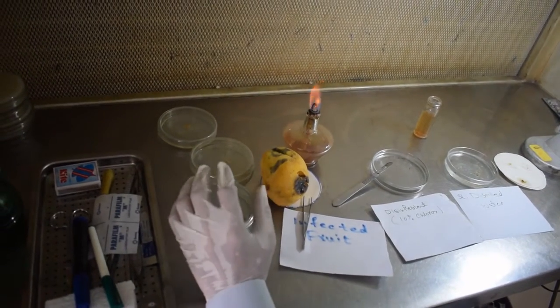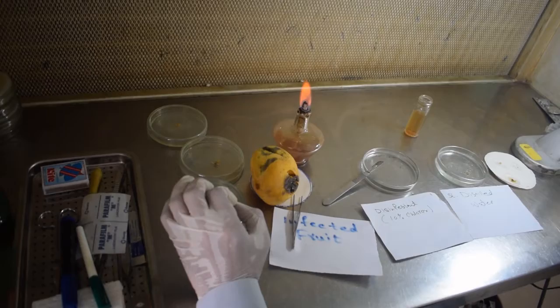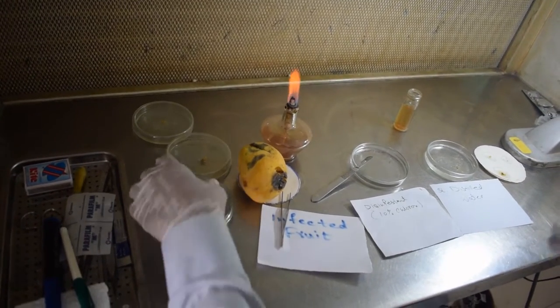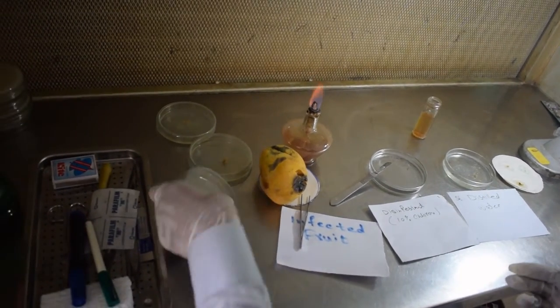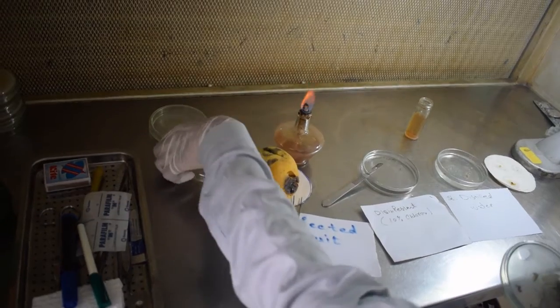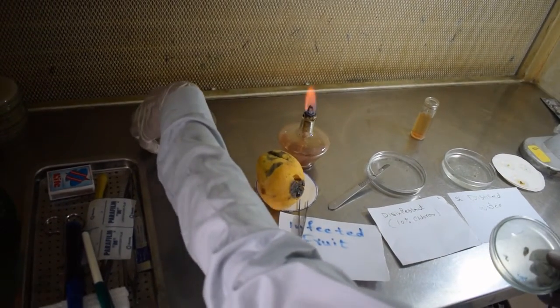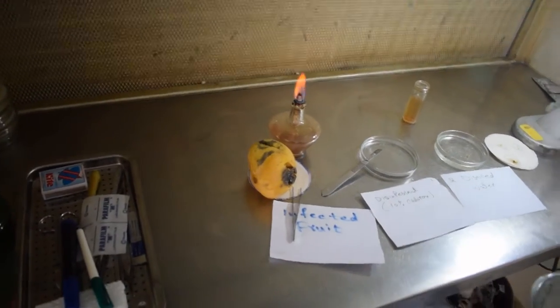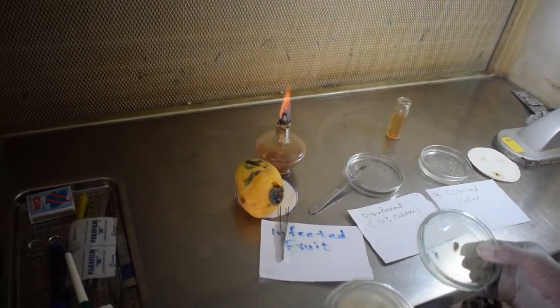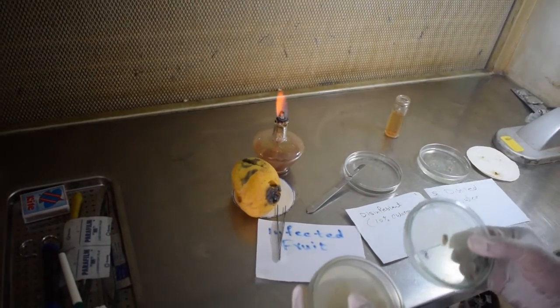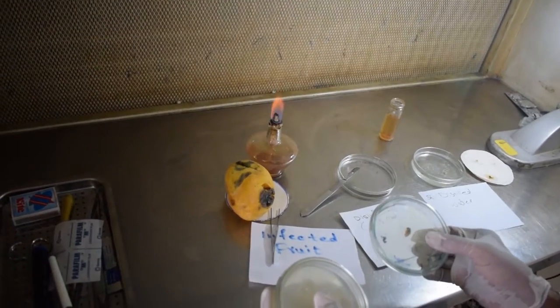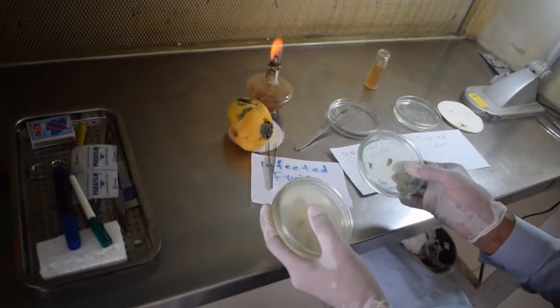Now we will keep them in the incubator for five days to seven days to see what is there. After incubation, we will observe that whatever fungus is there, it will grow.